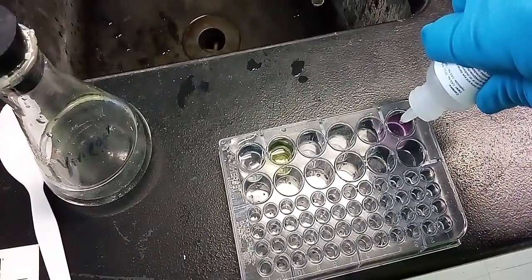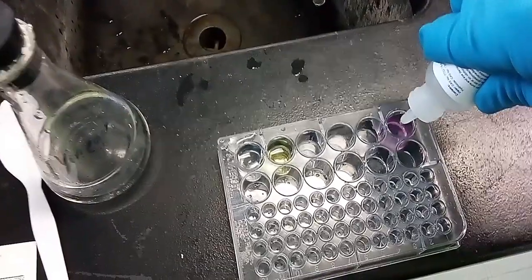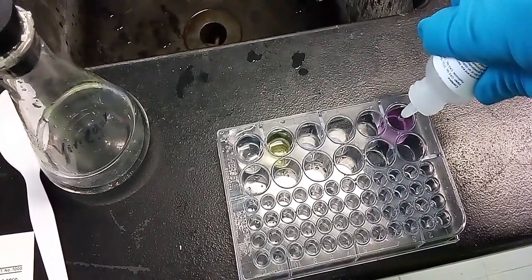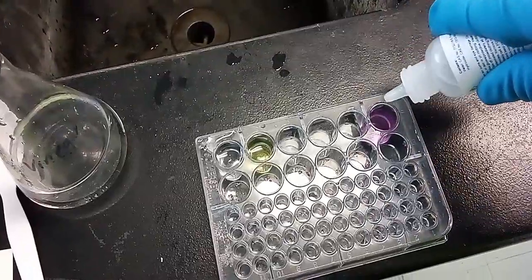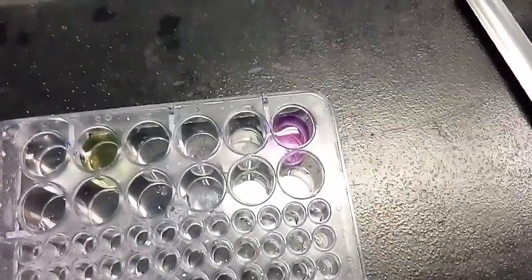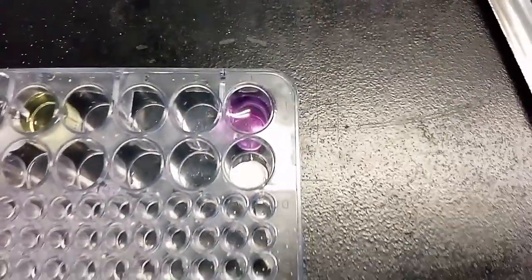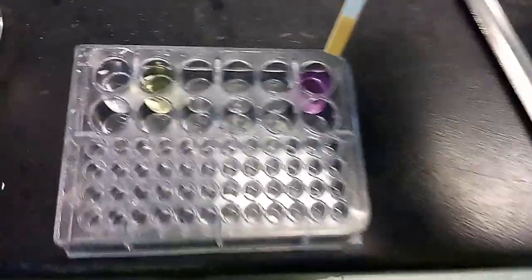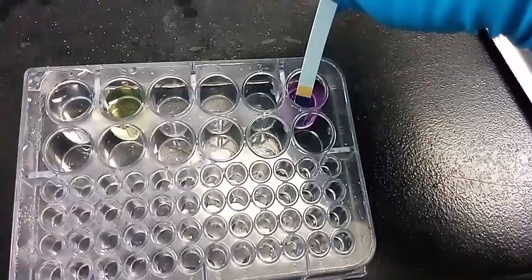And there was some phenolphthalein falling in there earlier, and you can see that it's turning this completely pink. That means that it's a base. Phenolphthalein in a basic solution turns pink. That's the color change in there. So some phenolphthalein fell in there. I got the pH strip in here, and let's see what color it turns out to be.